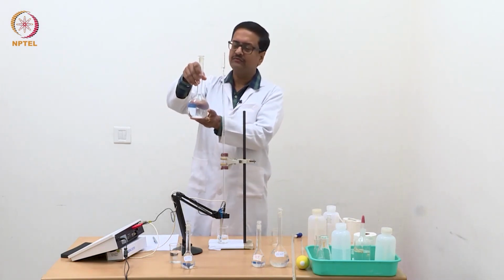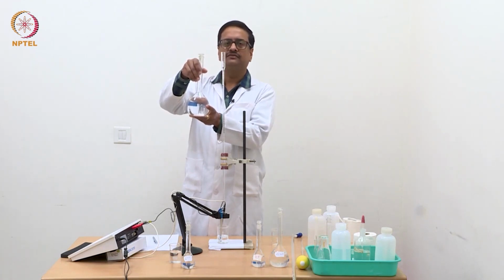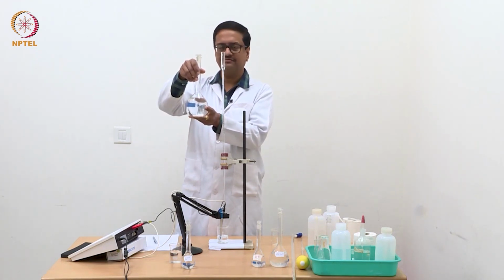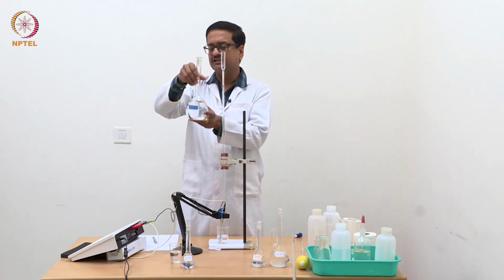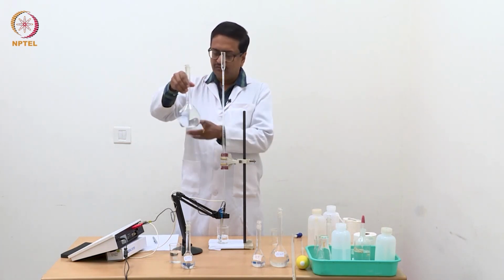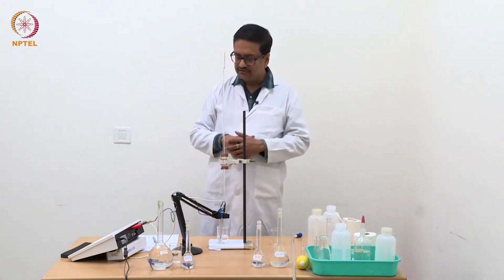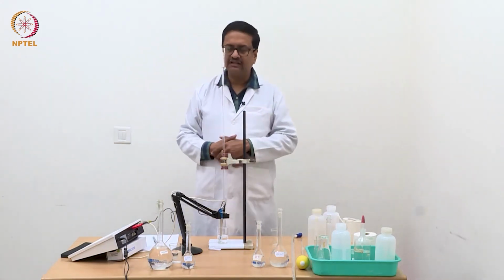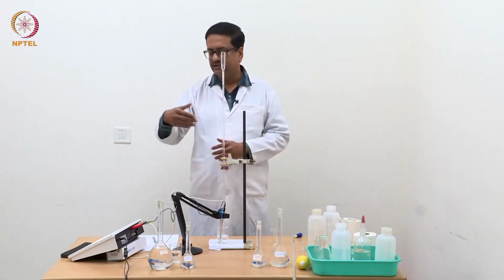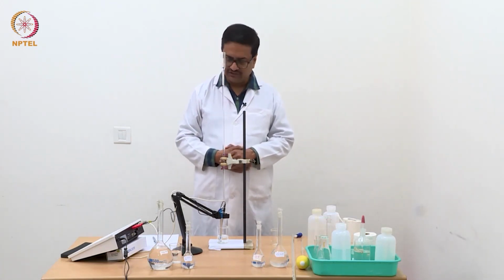By accurate weighing, we mean that the way that was followed for preparation of standard solution of oxalic acid in the previous experiment, we use the same method to make a KCl solution slightly more than 0.01 molar, and then we have used accurate dilution technique to dilute it in such a way that the final concentration is exactly 0.01 molar.